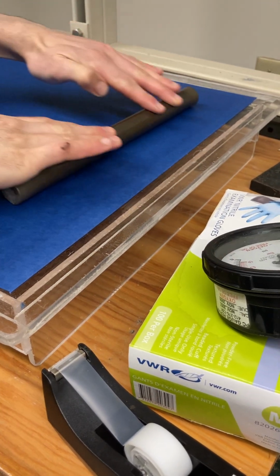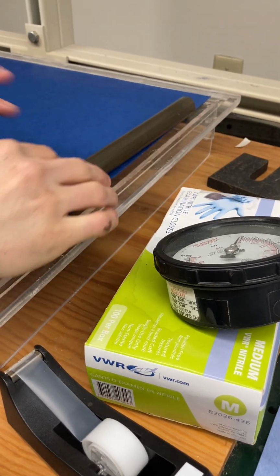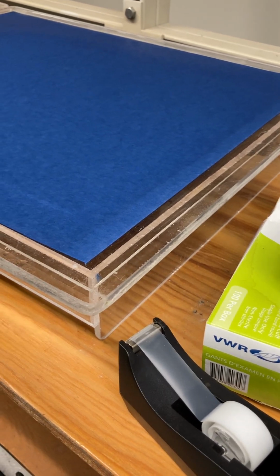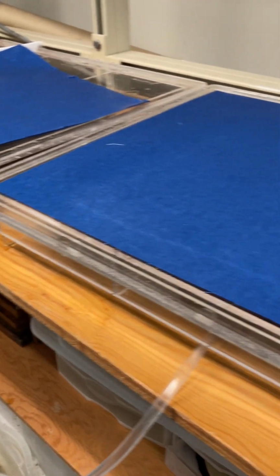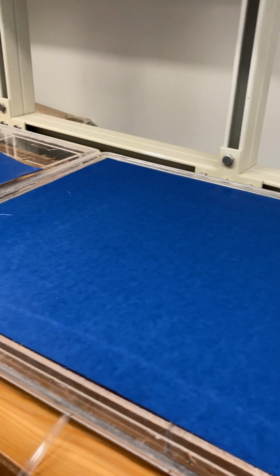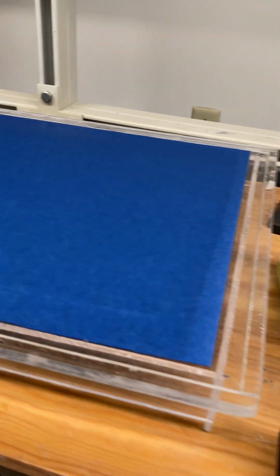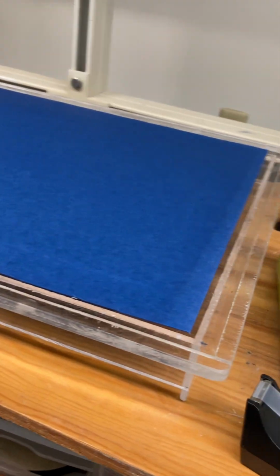The only difference between this one and this is a metal connection, whereas the other one's plastic, but I think there was probably too much air leaks to test the other one with your paper if this one works. Yeah, this one has got a leak in it somewhere, because it was happening even before we had really hit it desaturated, it seemed like. We can still try it if you like. I think you're right. I think I'll try and put something around, like maybe silicone or something, around the connection, and then I'll try doing what you did.